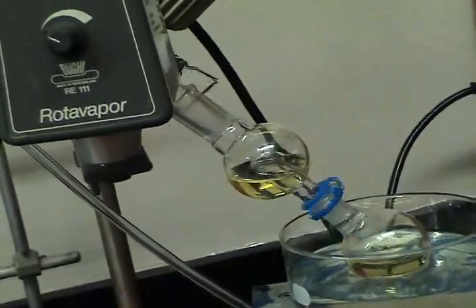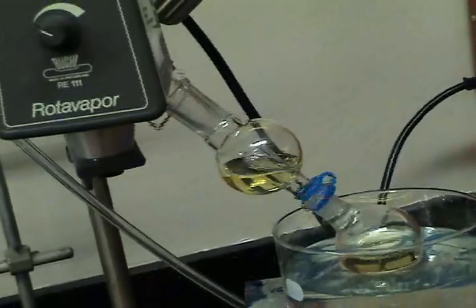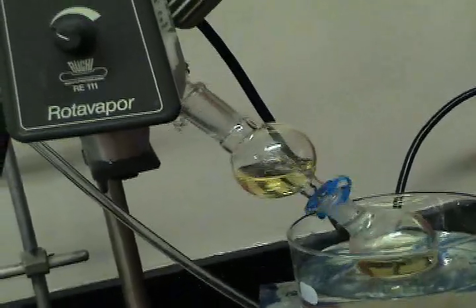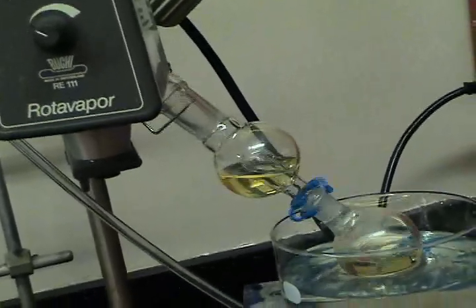Now that stuff up there, if that bump trap is dirty, it is now dirty. If not, it has to be washed back into the flask when you have solvent again.